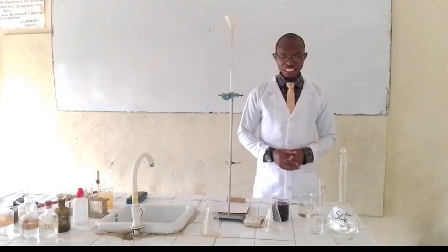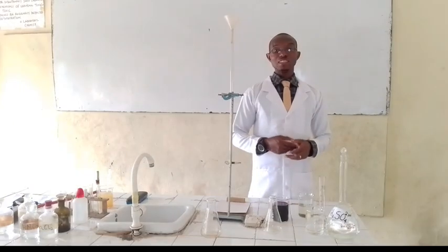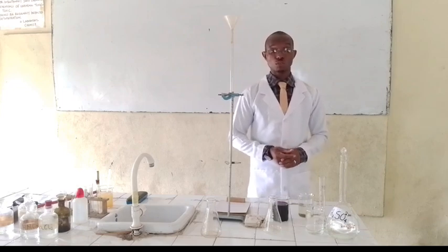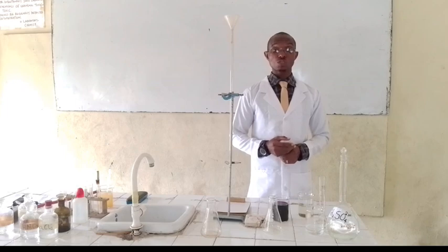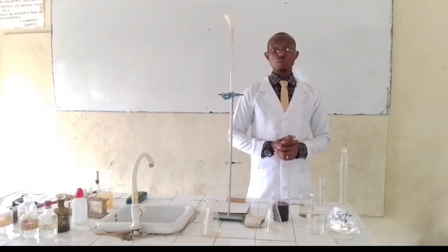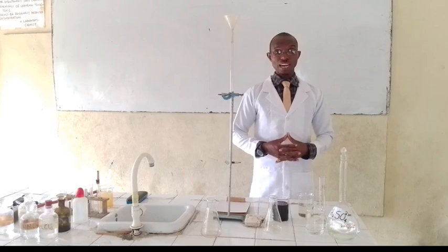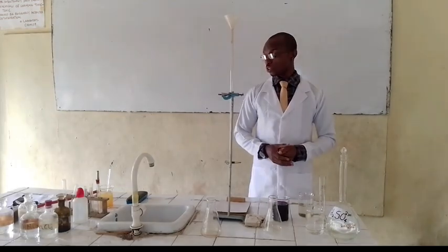Because our acid is an oxidizing agent, we will be needing a substance to help this titration come to fruition. That is why we will be needing an acidic substance — specifically concentrated H₂SO₄ — which we will use to acidify our base, so as to bring about the reaction we are hoping to get.